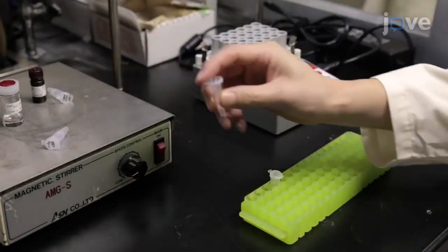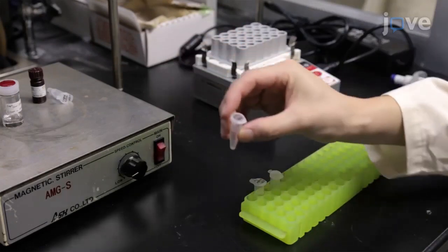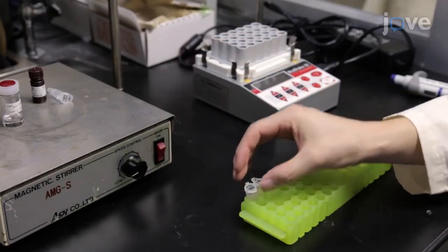Then, prepare the quantum dot-linked caged molecular glue by first making azide functionalized quantum dots.